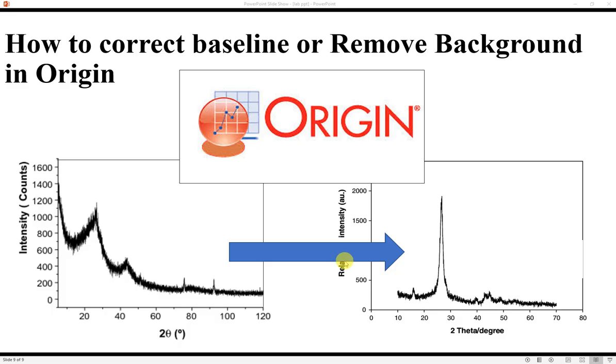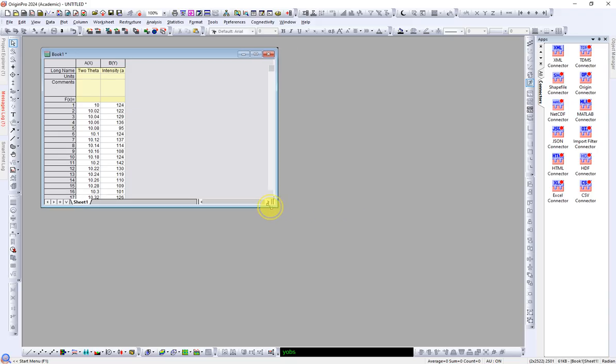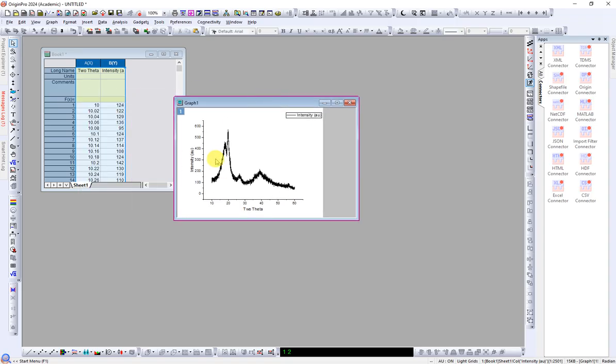I will use the XRD graph to teach you. So this is Origin and I have already imported the XRD data. My curve is pretty good, as it doesn't start from very high intensity; instead its intensity is around 100. But still I will teach you how to adjust this, bring it to 0 or up to about 50. The procedure will be the same for all.